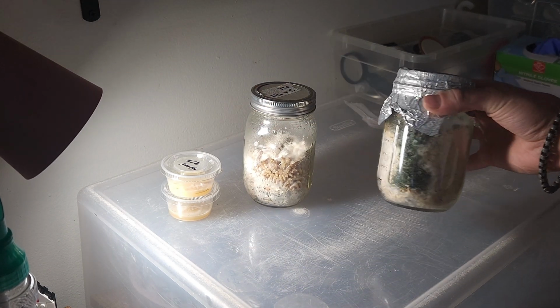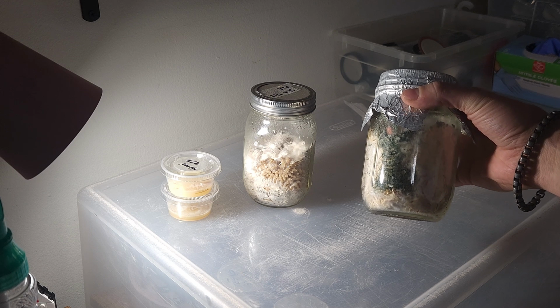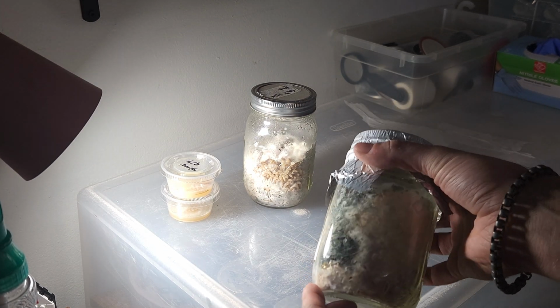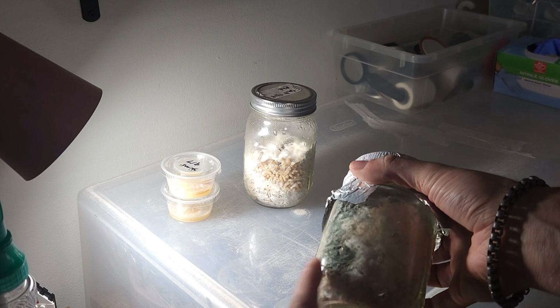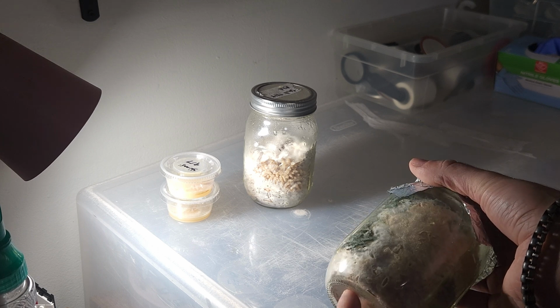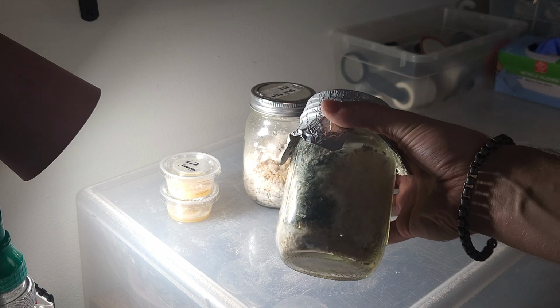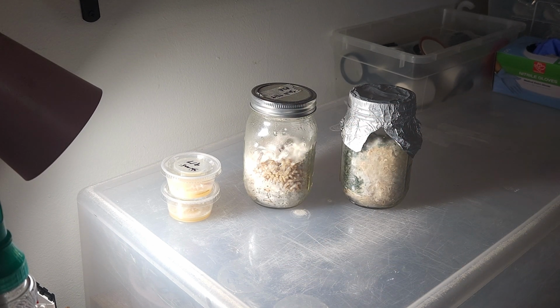Most importantly though, is discarding it outside in the trash, as you do not want to spread these spores, especially with trichoderma. When they've entered this green state, that means they've germinated and they are ready to spread as much as they can. It starts out not green, and then slowly, as it matures, it turns to this dark green color. It's super important that we bleach this and completely sterilize these jars after we empty them before we ever introduce new grain to them.